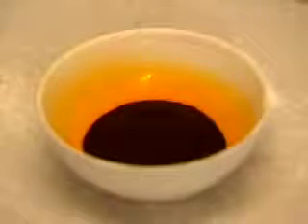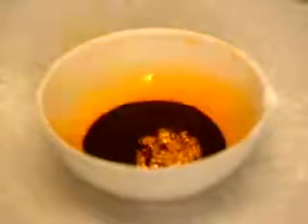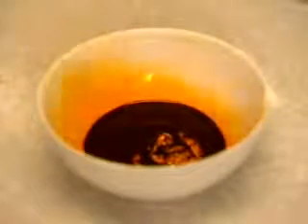With bromine, I just drop aluminium foil into the liquid. There's a short delay, but normal service is soon resumed. Once the reaction gets going, it quickly takes on the appearance of the pit of hell. As with the chlorine reaction, there's white smoke. That's aluminium tribromide.